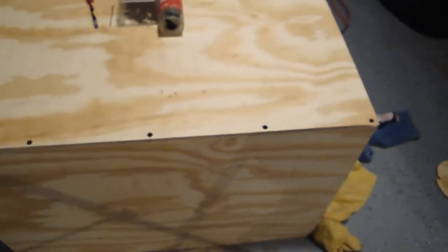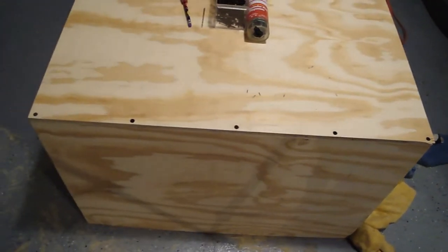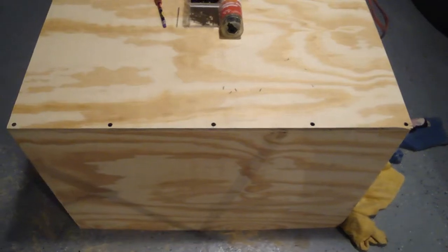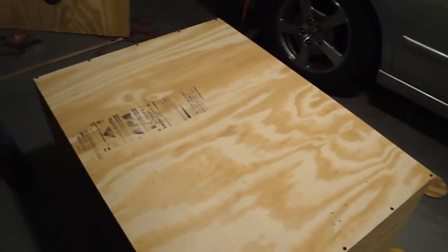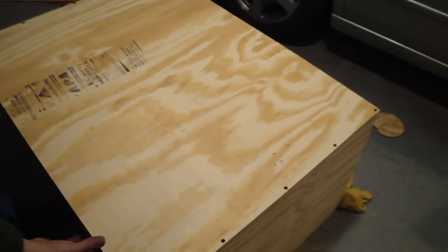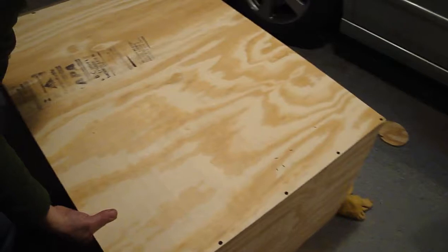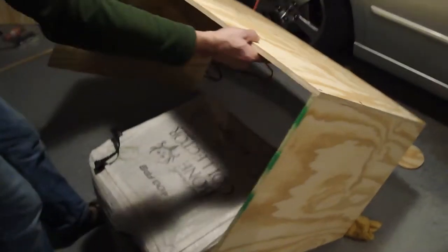We're going to do the other side. Now we're not going to record that because it's pretty straightforward. You just do the exact same thing. So now we've got both sides secured on. We can turn it over and get the top put on.